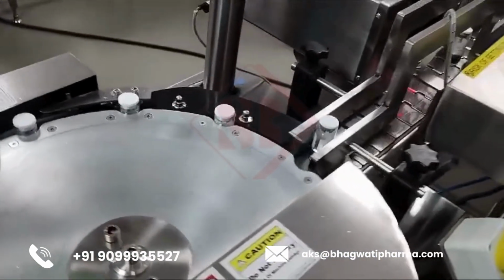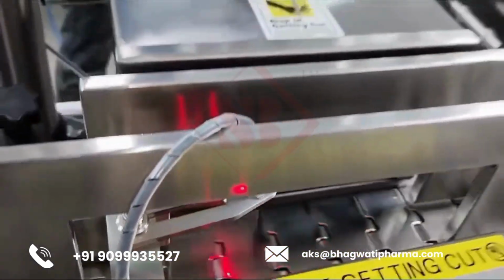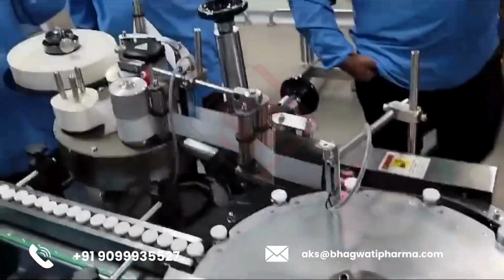Vision camera inspection system. High-resolution cameras. The machine is equipped with cameras that capture images of each vial and its label. Software algorithms. The captured images are analyzed in real time using image processing algorithms to verify that the label is correctly applied, legible, and free from defects, such as smudging, misalignment, or incorrect information.